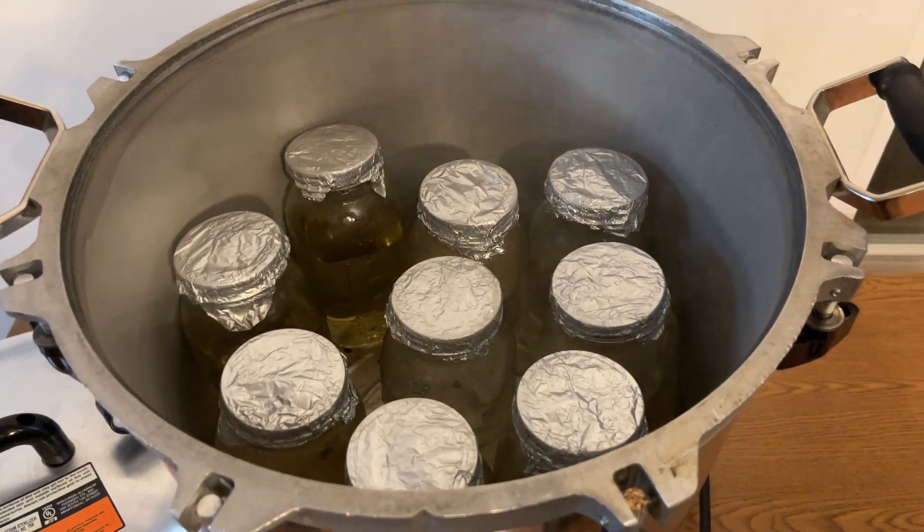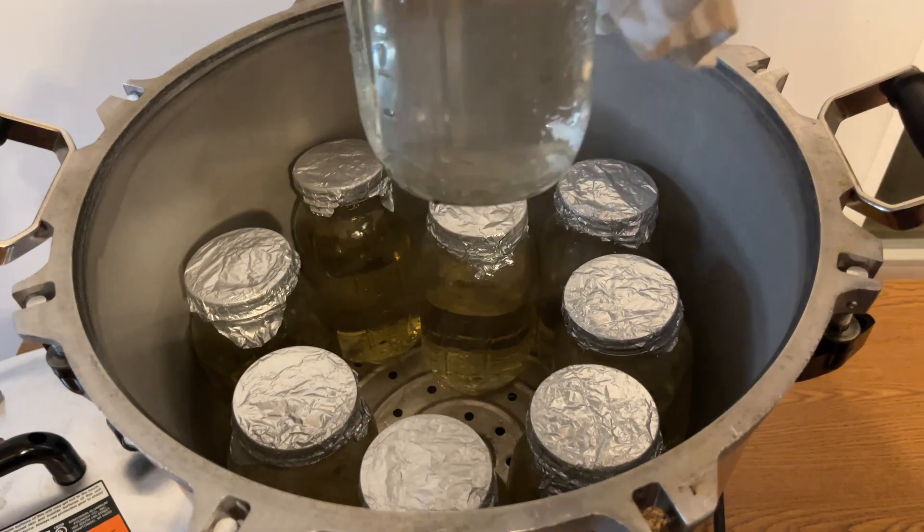After the jar of tree sap is done being sterilized I take it out and let it cool down to room temperature.